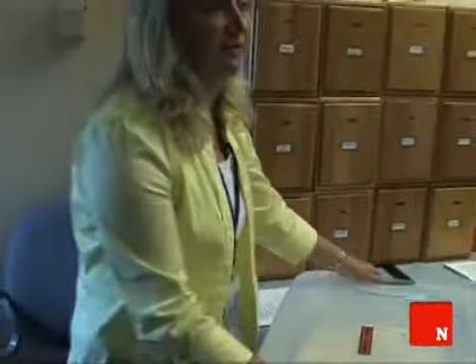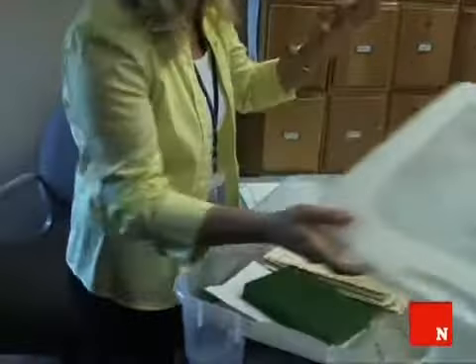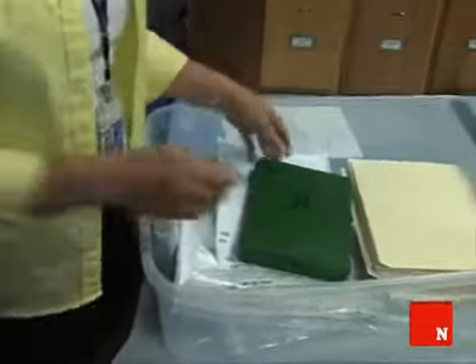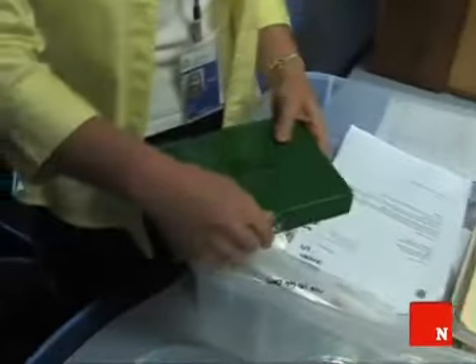In the case of Flight 1549 that went into the Hudson, we actually received over 100 samples, somewhere around 100 samples, I think, in total. We made microslides from all of the samples. We did DNA analysis from all of the samples. So at this point in the investigation, so far we have identified Canada geese in both engines.